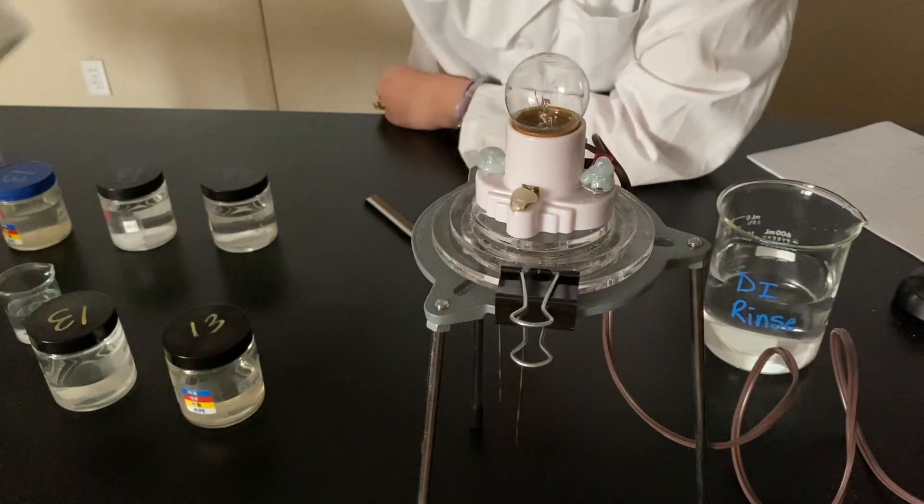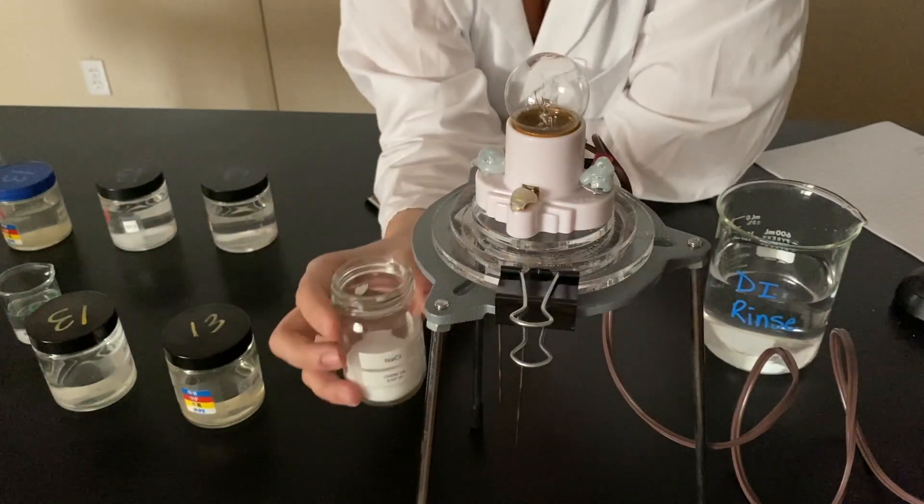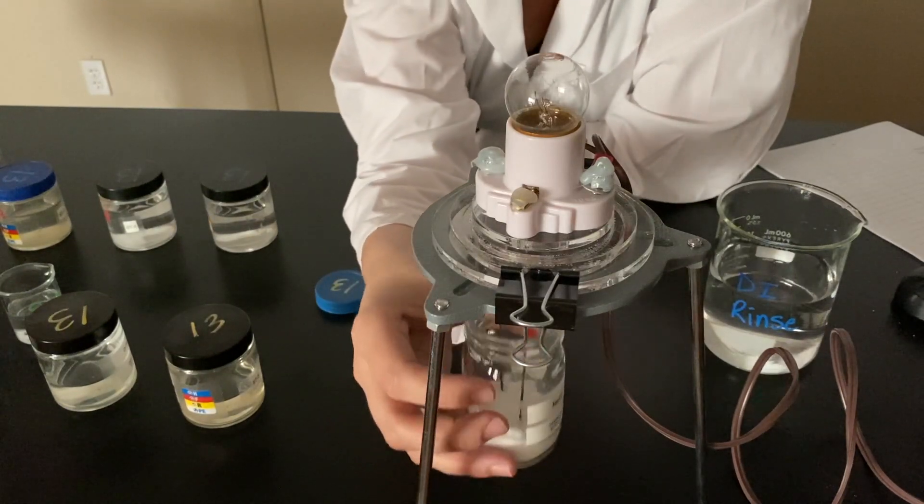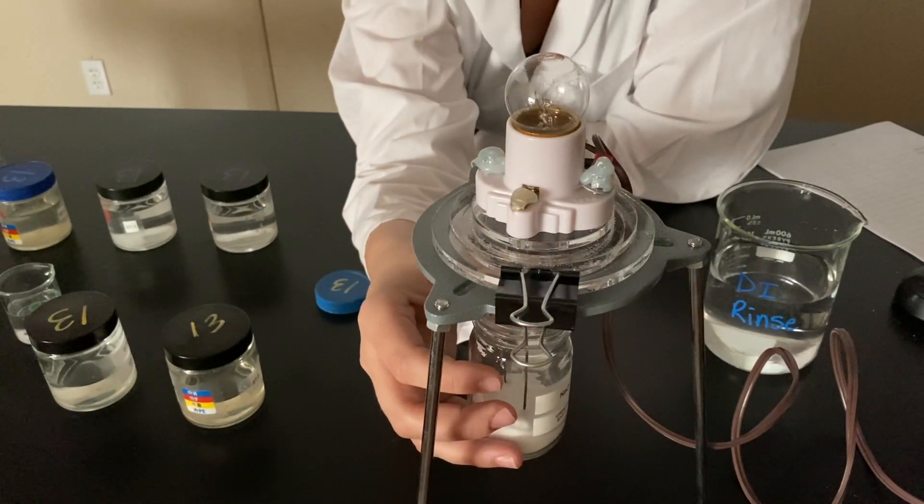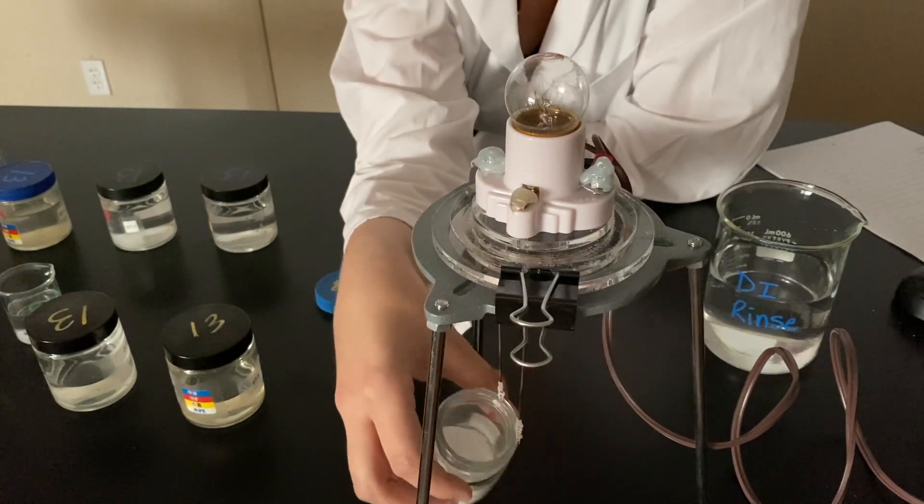Next is salt, I believe. NaCl. Table salt as a solid. Nothing.